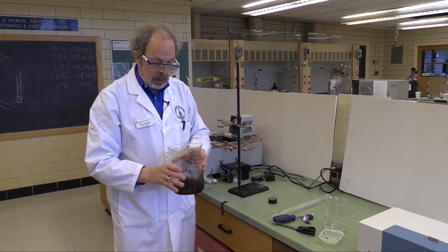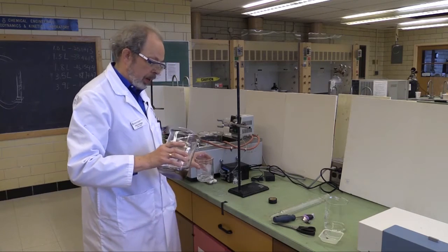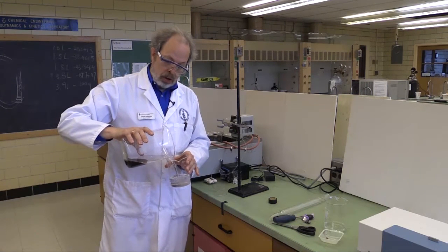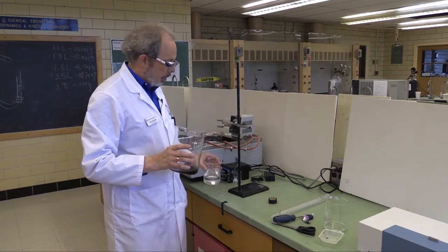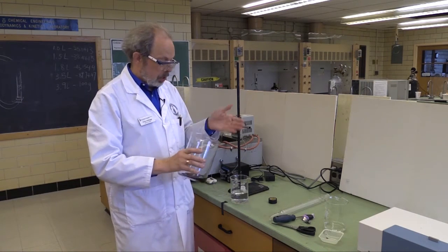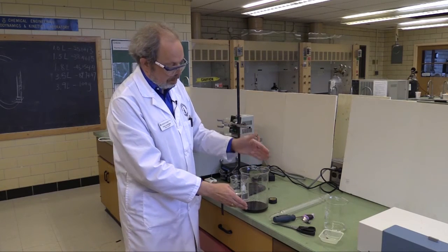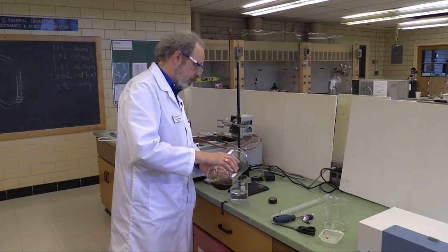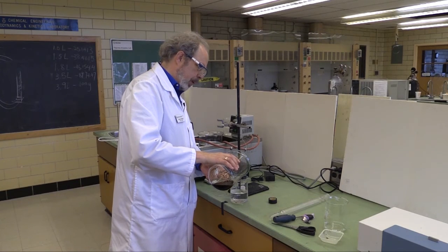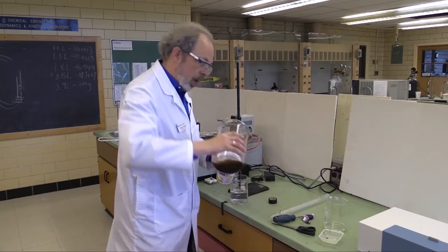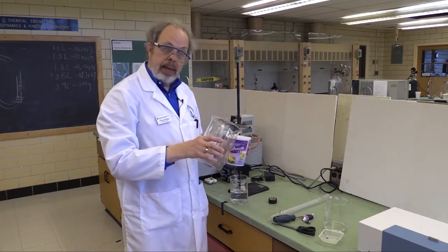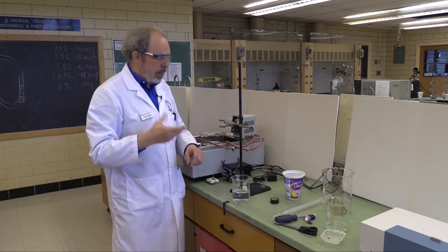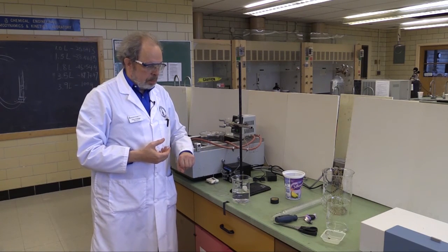This is water you can swirl around and decant. Decant meaning pour away from the liquid at the bottom. I'm using a beaker, but you can do this over a sink. Pour away as much of the liquid as you can. And then more water, swirl it around and dump so that you're sure that this liquid, this resin is as clean as possible. Once you have finished that, which will take a couple of rinses, and you've poured as much of the liquid out as is reasonable, there'll be a plastic tub for it, and you can dump the resin into here. It will dry in here, and it'll be used in future weeks, because the resin itself is recyclable. It's not single use.